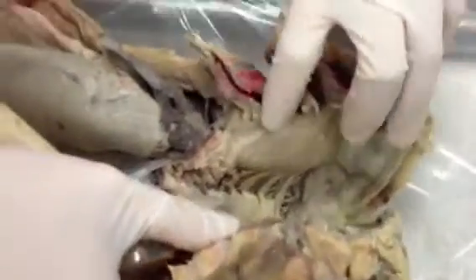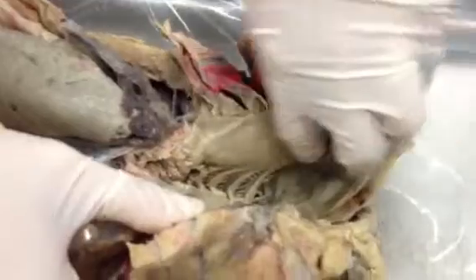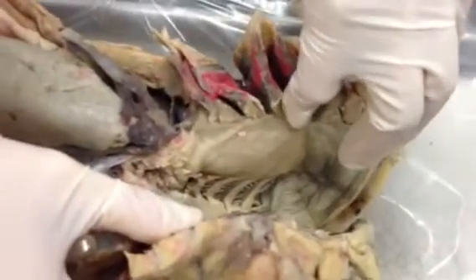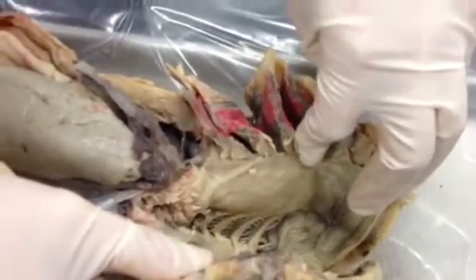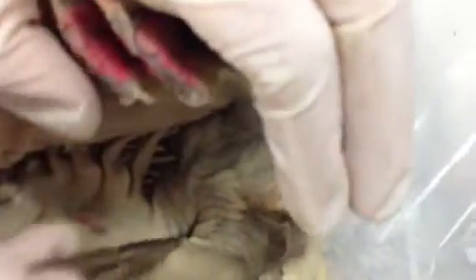On the floor of the cavity, you're going to see the primary tongue, and it's less mobile than the human tongue or the cat tongue. You'll also see the opening for the spiracle here, and if you stick your probe through, you'll see it come out the other side where the spiracle would be.